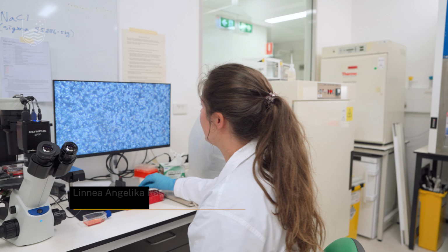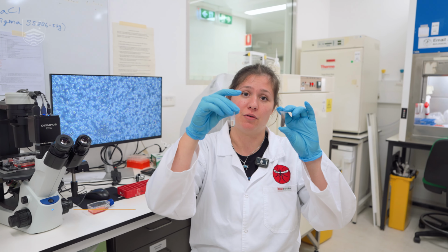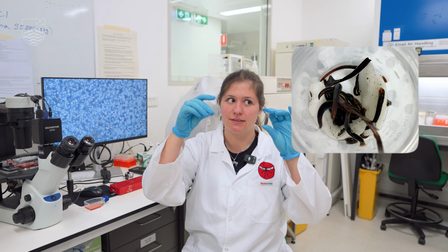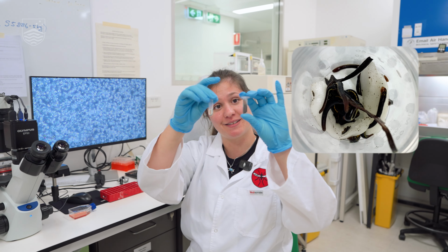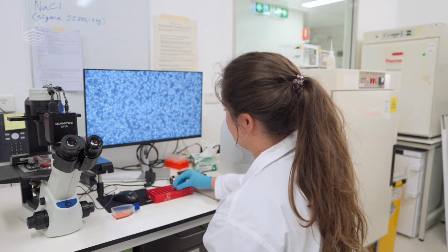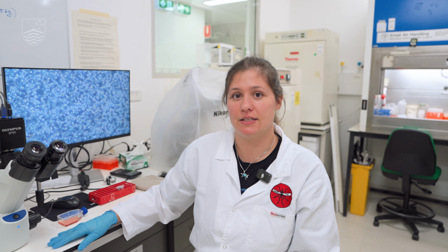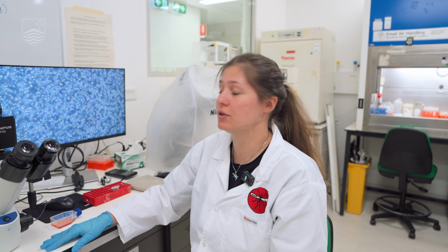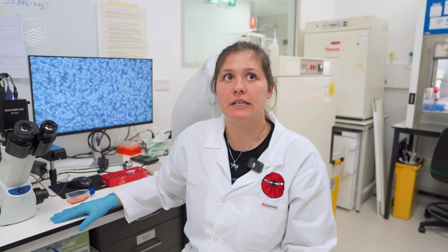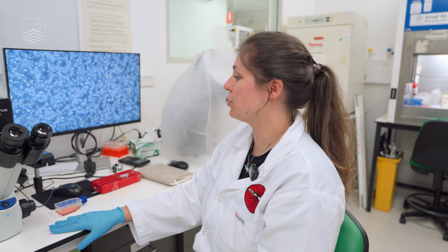These little parasites are actually within these leeches. Some of you might have even encountered them during a hike or bushwalk and looked down and were like, oh, something pinched me. Well, that's these ones. I'm looking into the trypanosomes within these leeches to see what species are in them, because some trypanosome species are known to transmit really severe diseases such as African sleeping sickness and Chagas disease. So we want to see what potential leeches have as vectors for trypanosomes.